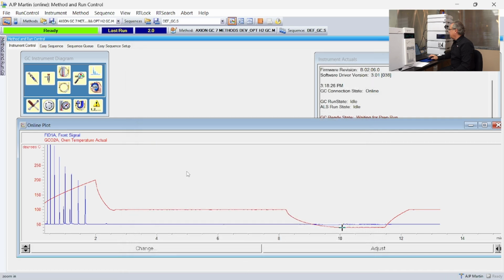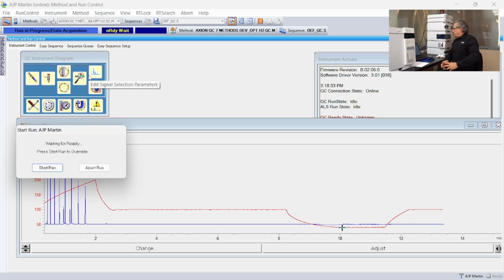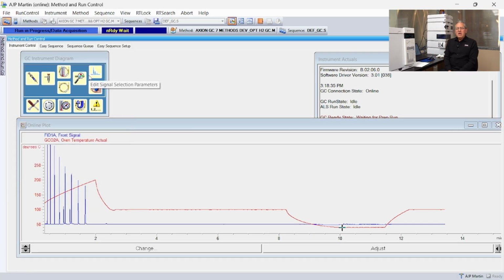And we'll leave all the other conditions the same. And we'll start the run. Now this is a liner, I'll call it a new liner. Probably not brand new, it's probably something we've cleaned before. But it's been sitting around, I may have touched it with my fingers, so I wouldn't be surprised, on the very first injection, to get some extra stray peaks, extra ghost peaks here and there.